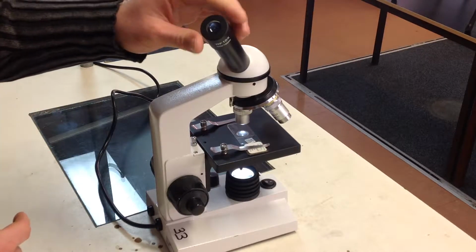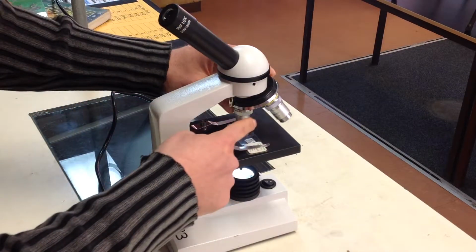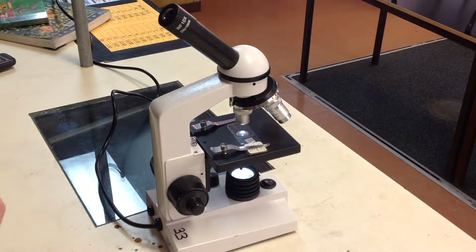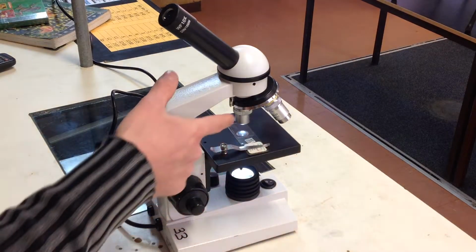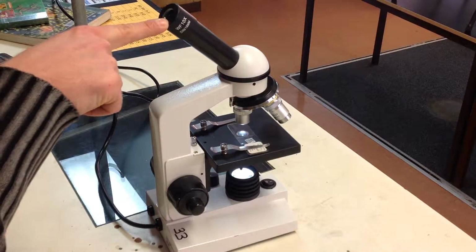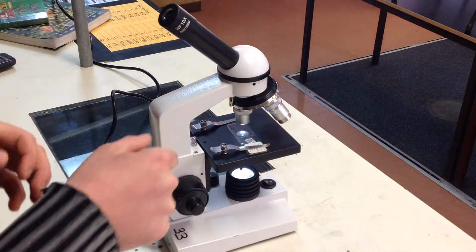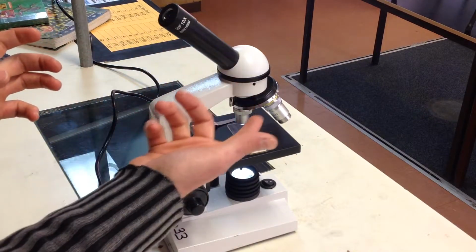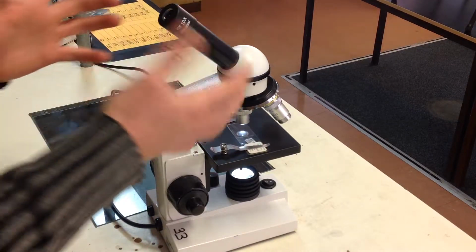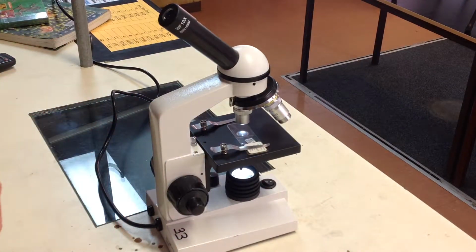Also, it's a bit of a recap for you as well. Hopefully you remember this, but in each of the lenses, the eyepiece lens and also the objective lenses, they have a number on them, which is a times number, and that's how much magnification those lenses provide. So for example, the lowest power objective lens here has a times 4 in it, and the eyepiece up here has a times 10. And the way we work out total magnification, so how much bigger what we're seeing through the eyepiece is than what it is on the slide, is by timesing those two lenses together. So if we do 4 times 10, it gives us 40, which means that with this setup of lenses at the moment, what we're seeing is 40 times larger than what it is on the slide.